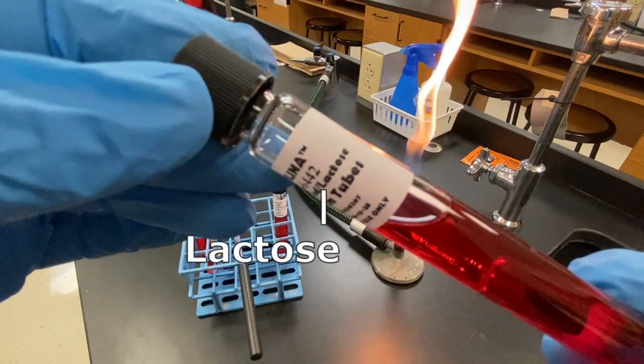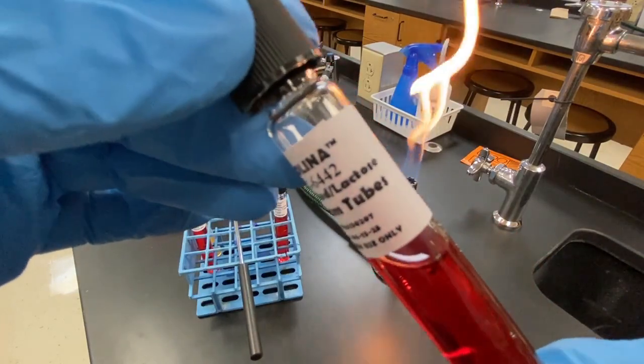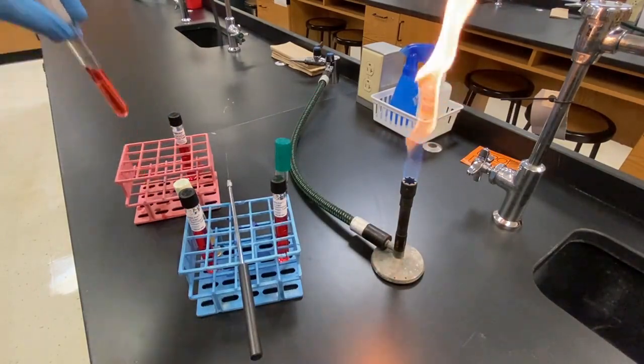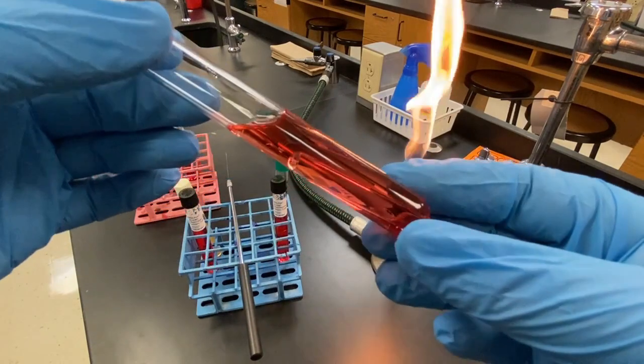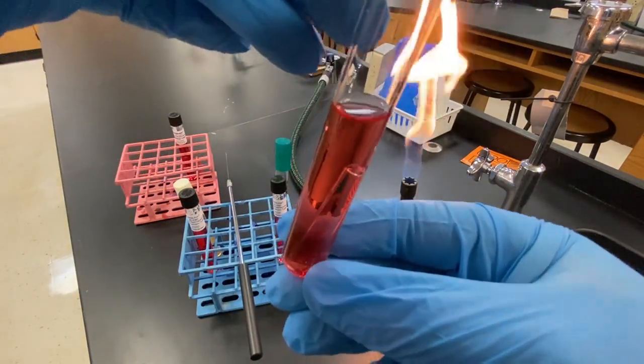This PR broth contains lactose as the sugar. And this PR broth, with the white cap, contains mannitol as the sugar. Here is the Durham tube shown moving side to side.